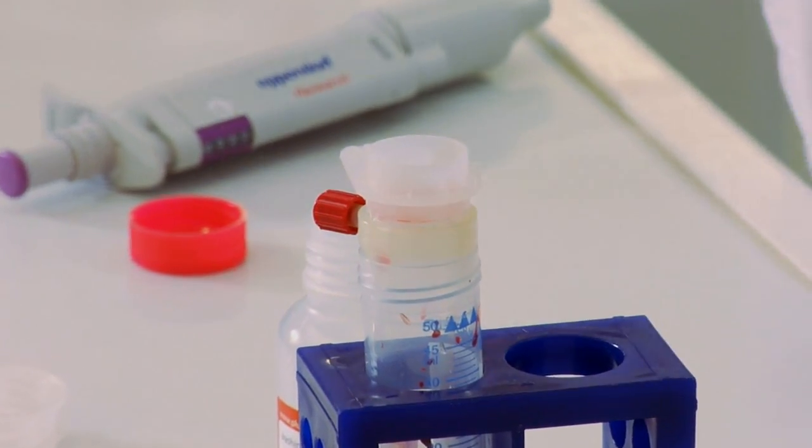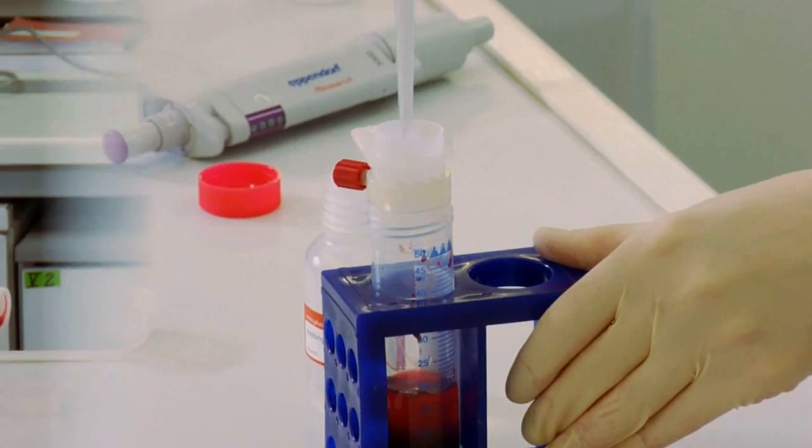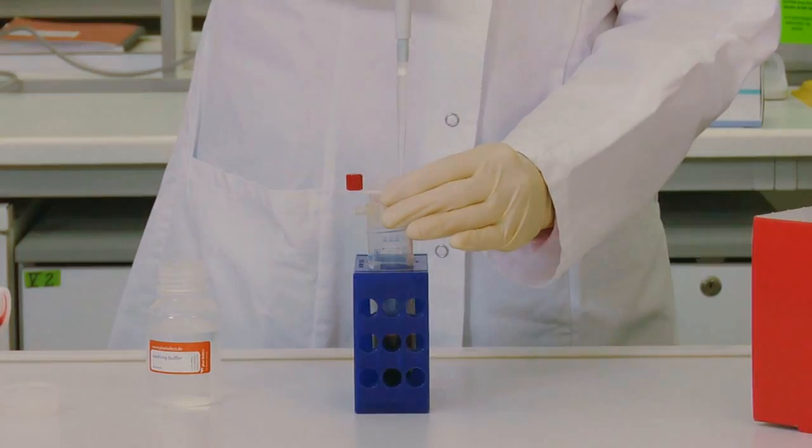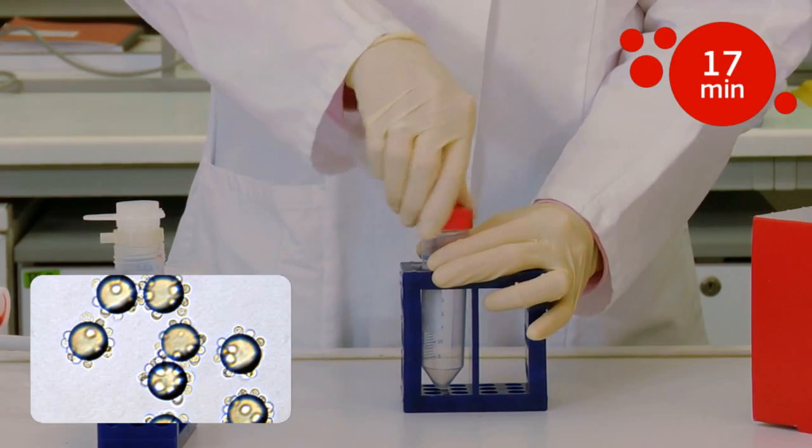Both the mixing container and the sieve are then rinsed with a washing buffer. The sieved cells including catcher particles are still caught in the sieve.